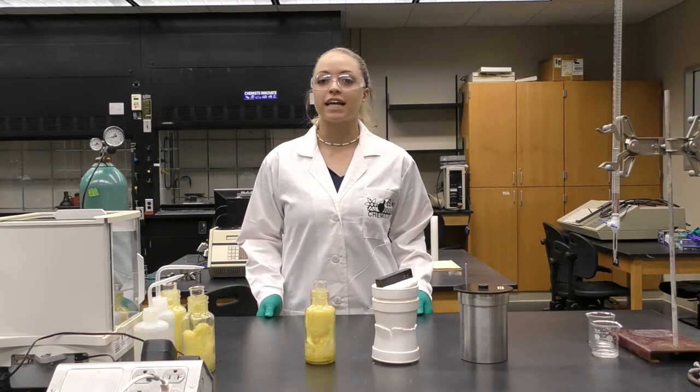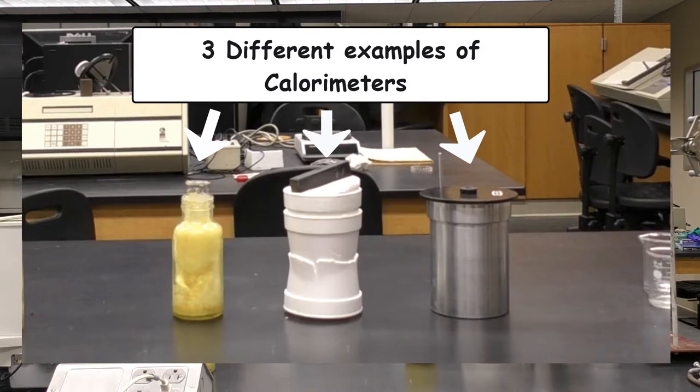Hi, my name is Kaylin Chapman. Today we'll be doing an experiment to demonstrate how to use a calorimeter. In front of me you can see three different types of calorimeters.